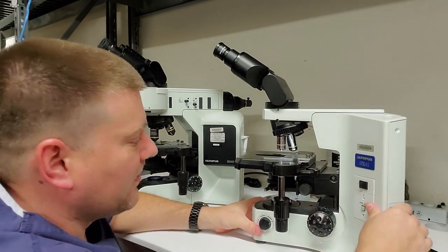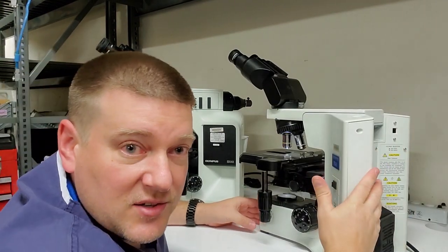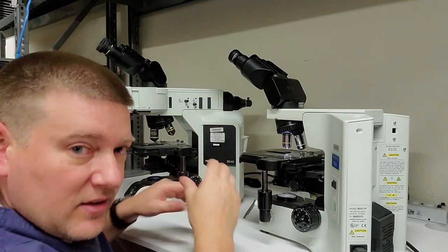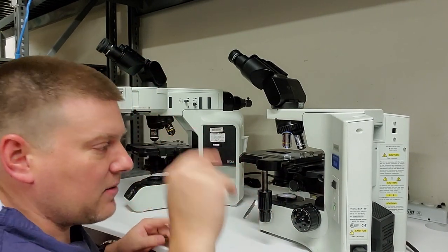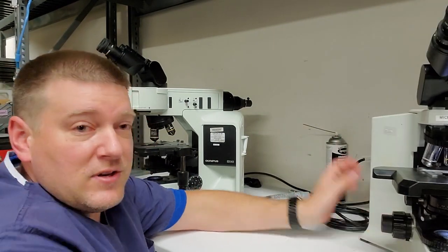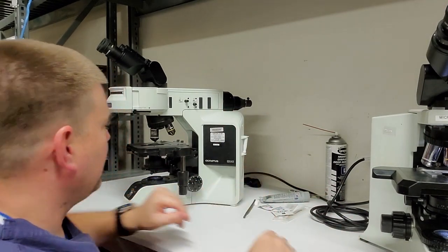All right, so that's your light channel to your bulb, and then there's an integrated power supply on most of these, except for the LED models. The LED models have an external power supply. We'll get to that in a minute. So that is all the features of a generic bright field microscope, okay?